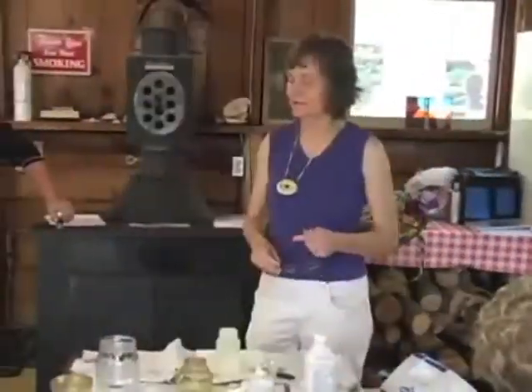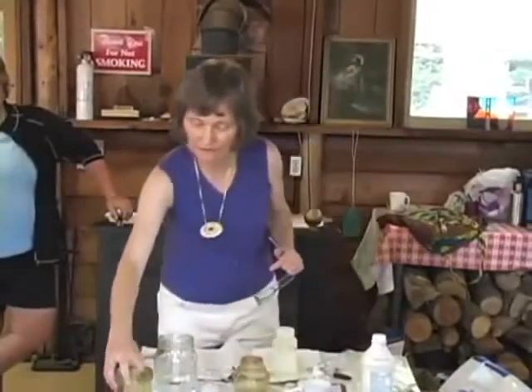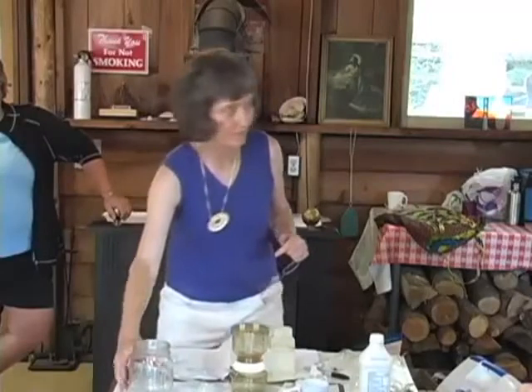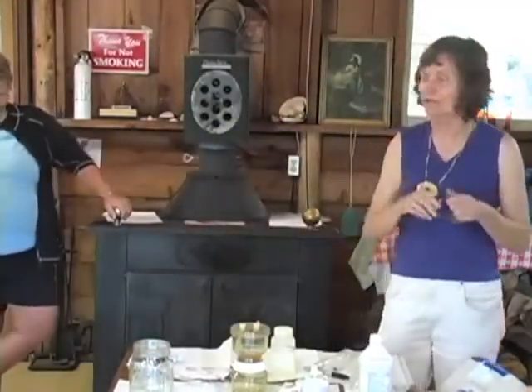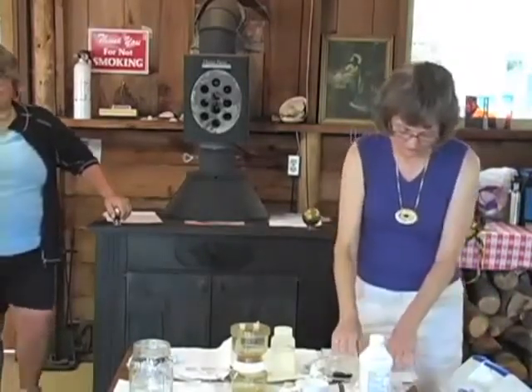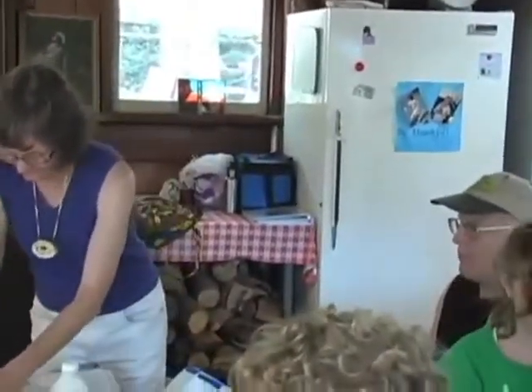Okay, so this should still be clean. Now I'm finished with this. 44.5 is what we're aiming for. So who would like to do some steps? I'll just get a volunteer for each step. How's that? So thank you, Dave. Come on up. I think we got some bodies here. All right, come on down.